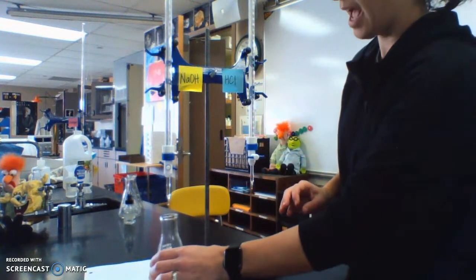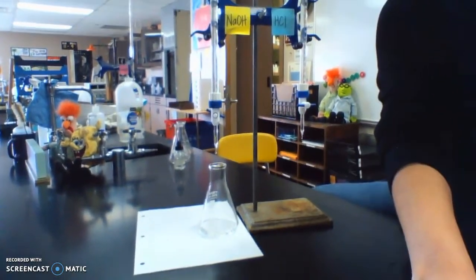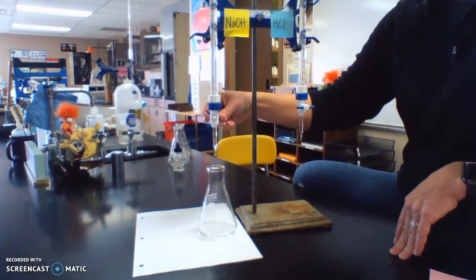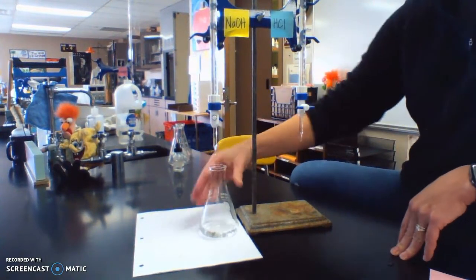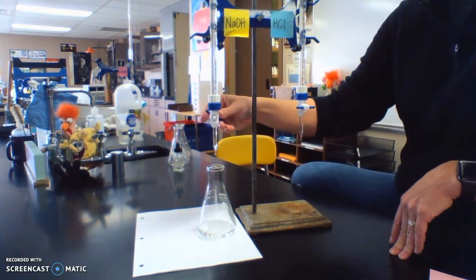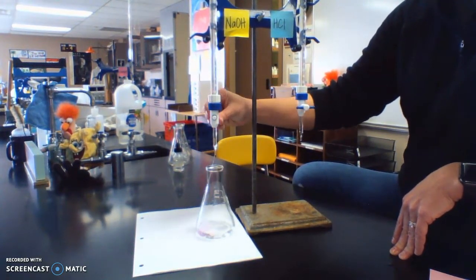So what we're going to do is add the NaOH, and what we're looking for is a pink color. I'm going to tilt this down a little bit so you can see, and I have it on white paper, because what we're looking for is a very faint pink color. When some of this interacts with the indicator, you can see that pink there, but then it goes away because there's still more acid. What we're looking for is the perfect balance between equal amounts of NaOH and HCl, and what we're going to see is a very light pink, or a pink that stays for about 10 seconds or so.